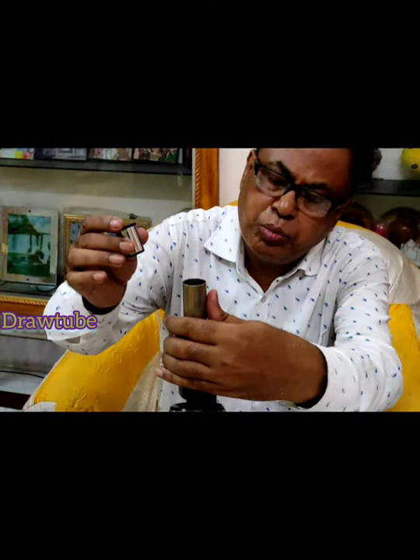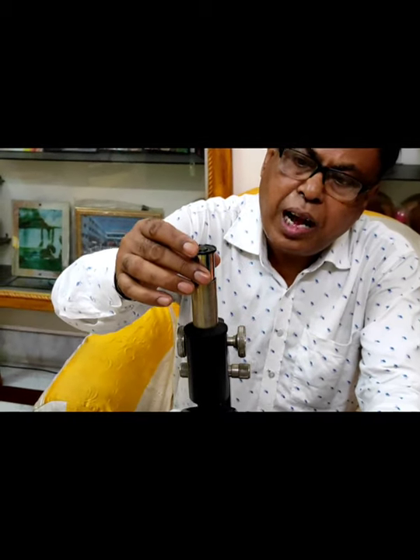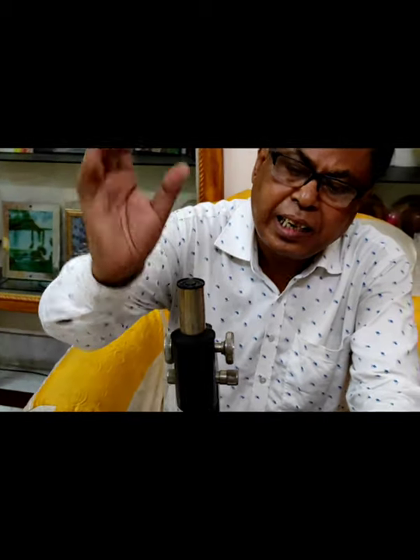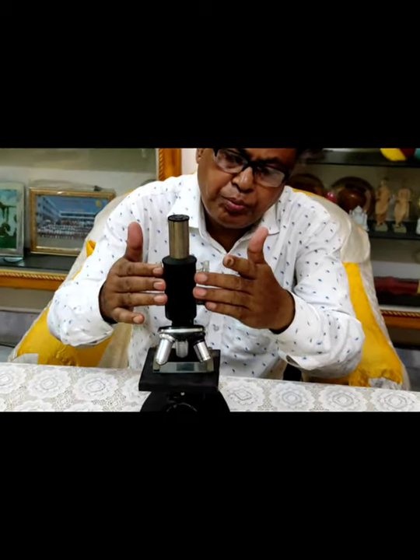This is the draw tube on which the eyepiece are kept.